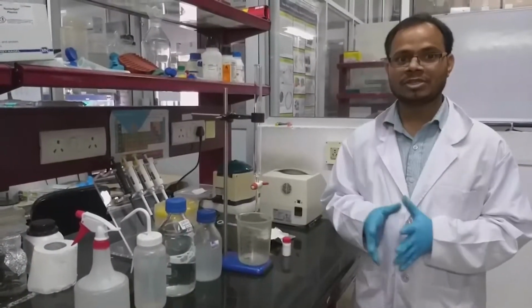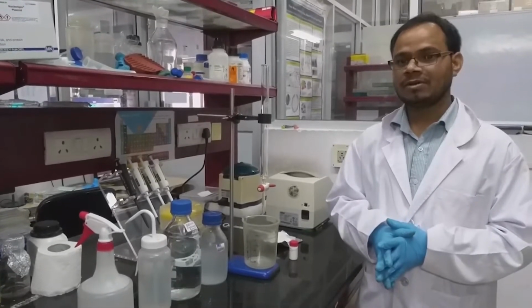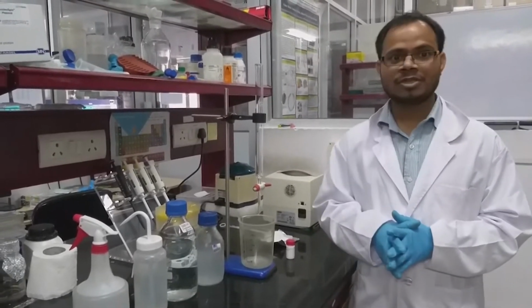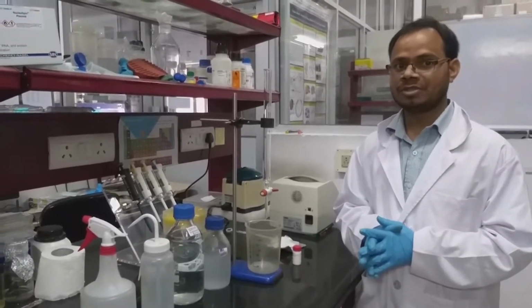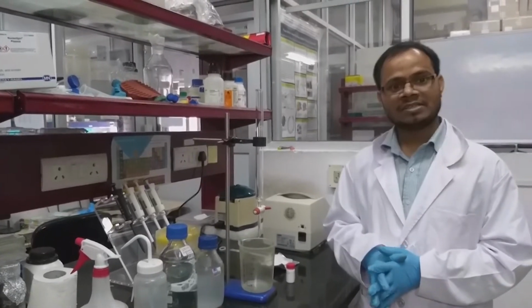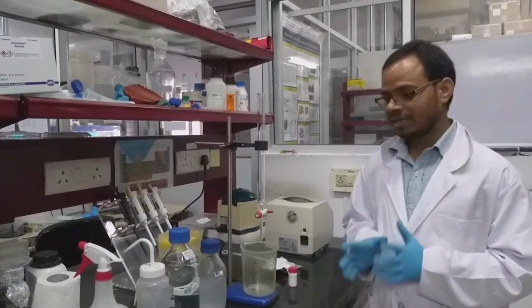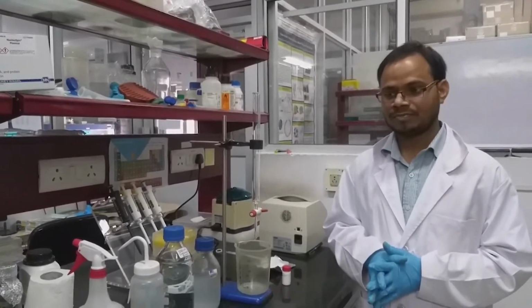In this video, we will demonstrate how to perform gel filtration chromatography or size exclusion chromatography. There are various methods available in chromatography to separate different types of biomolecules. For example, if you want to separate based on size or shape, gel filtration chromatography suits the most. If you want to separate molecules based on their charge, you can go for ion exchange chromatography. But in this video we are mainly focusing on gel filtration or size exclusion chromatography.